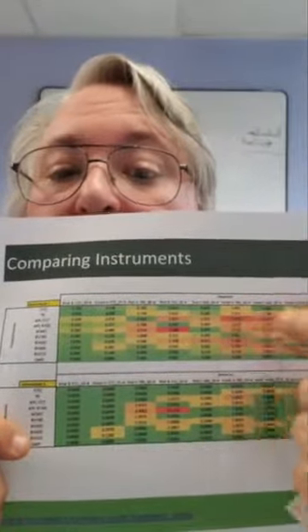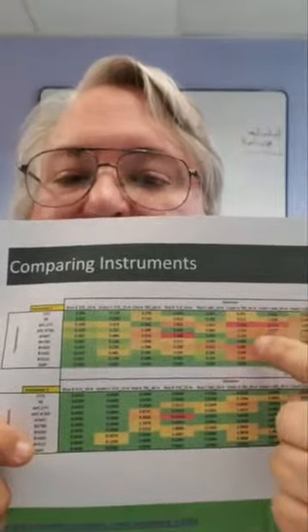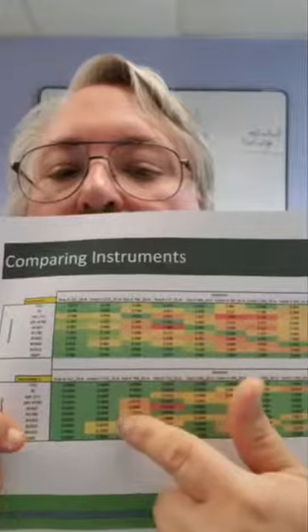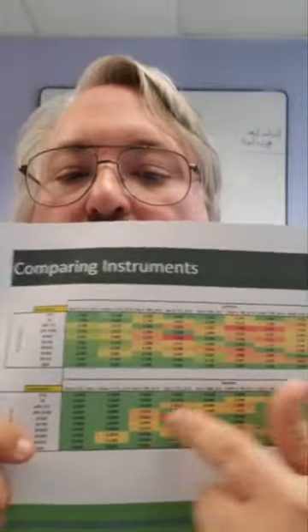If I'm running this instrument and I see this happening, this is an indication that there may be a problem with the machine. This machine here is much cleaner, and you can see there are a lot better areas to design a panel using that instrument. You may also want to then investigate what other differences there might be. Are there laser differences? Are there other options that might be causing that difference?